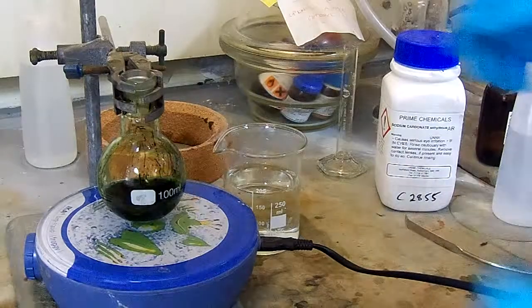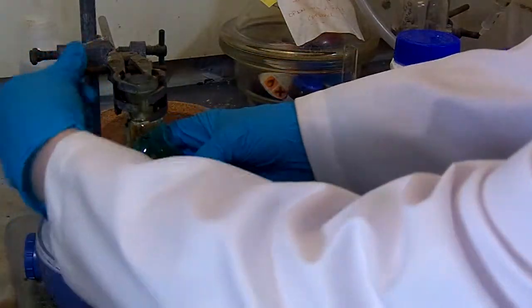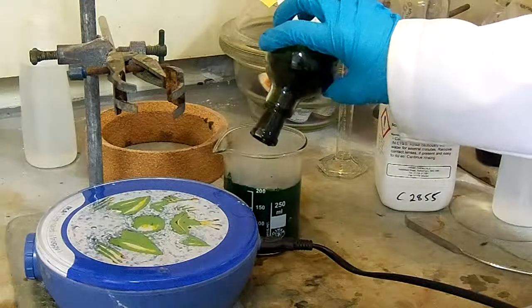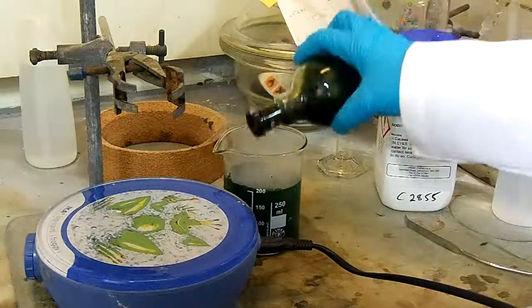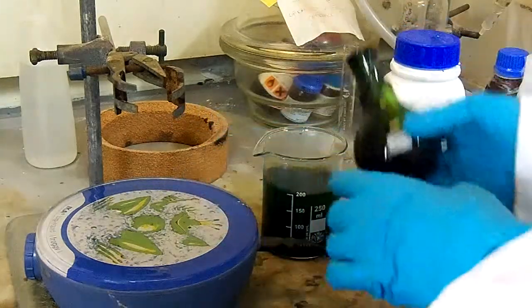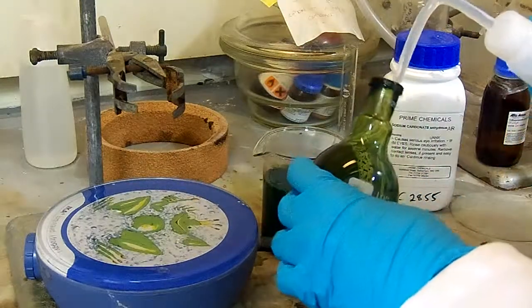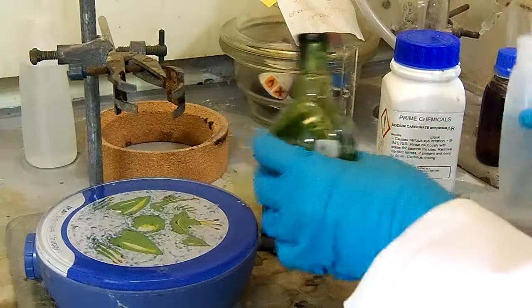After 4 minutes, immediately transfer your reaction mixture into a beaker of water. Wash the reaction flask with both water and dichloromethane to ensure complete transfer of your product.